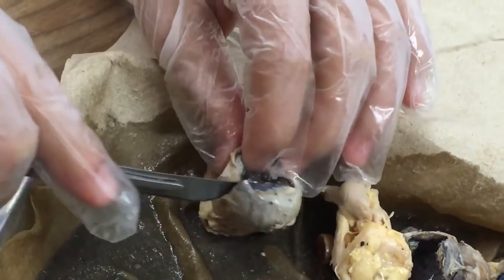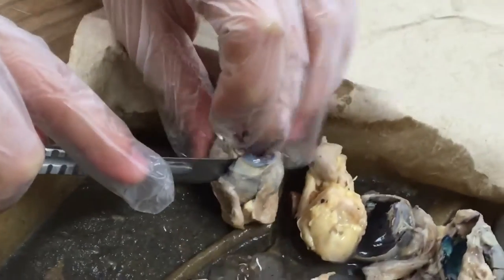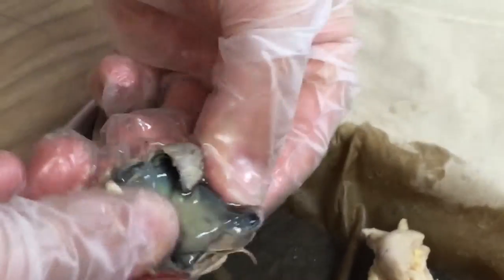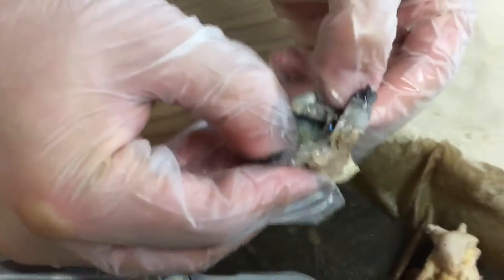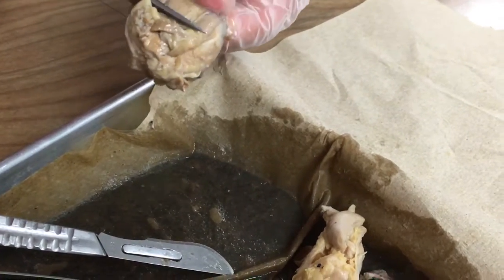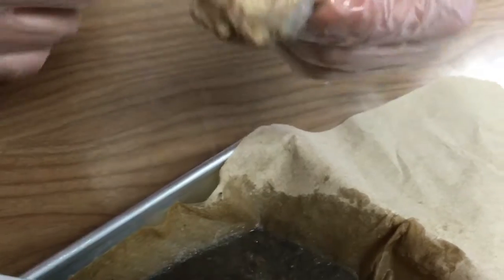She usually did it like in November — cut it open like a loaf of bread. Shut up. Let me look. Actually, I'm gonna have to tweak it. That's real. Let's just fold this. Oh, there's still jelly in there. That's so nasty. It's so hard to cut into, man — it's all the muscle. How do I see this? I'm gonna post it like, asterisks, dissecting a deer brain in anatomy. And then it's like, just cut the brain like you're cutting a loaf of bread.